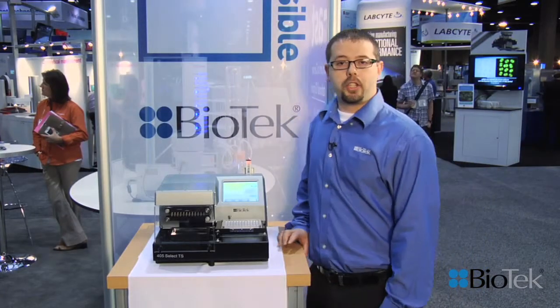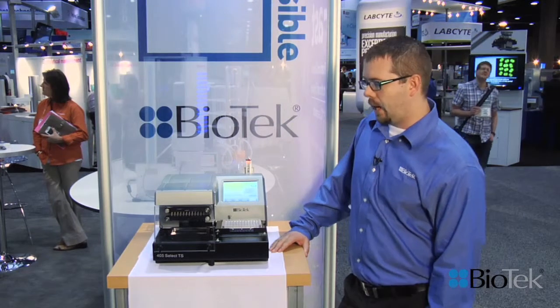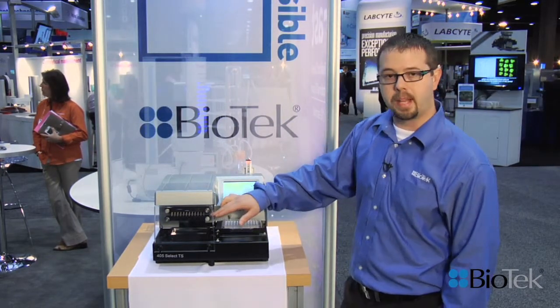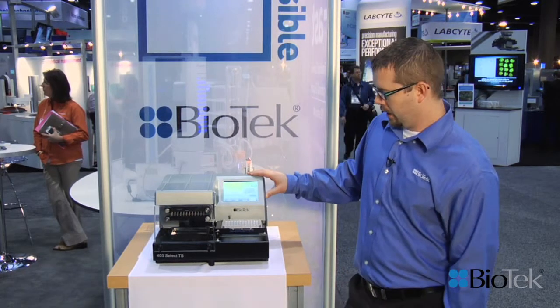Verify Technology is a quality control tool that allows you to easily detect clogs in the aspirate and the dispense manifold in the wash head. So how does it work?